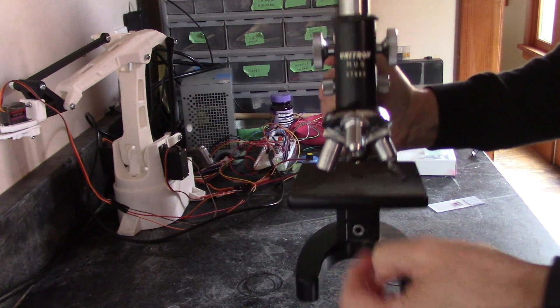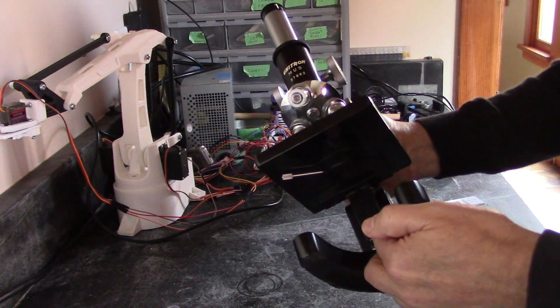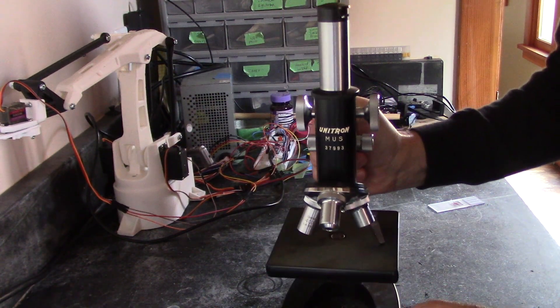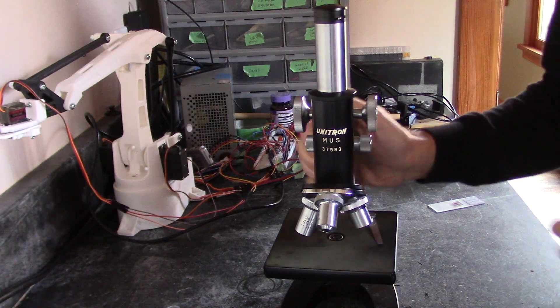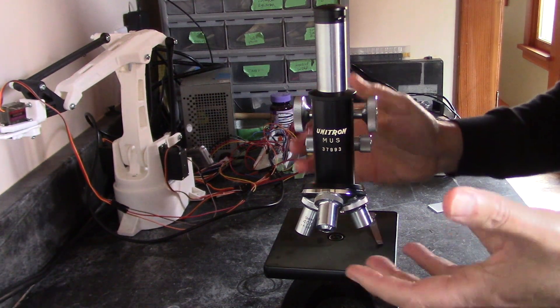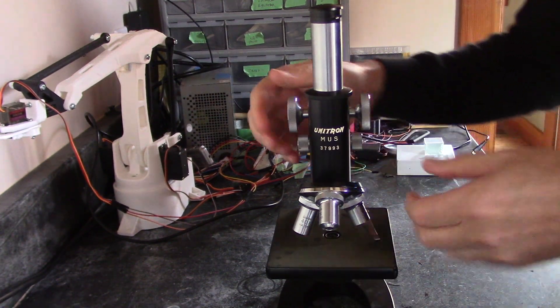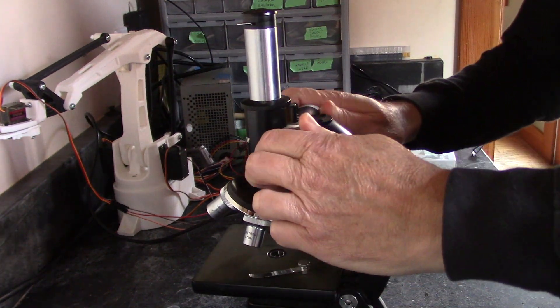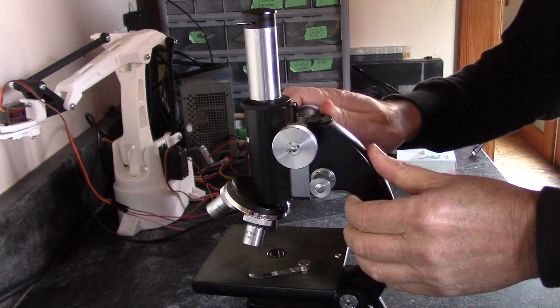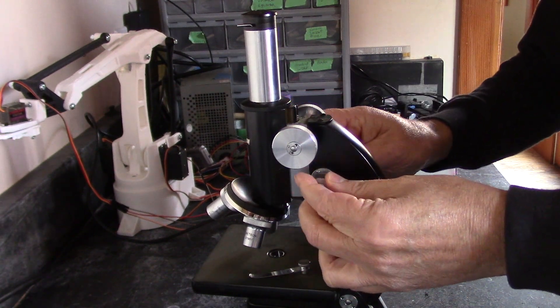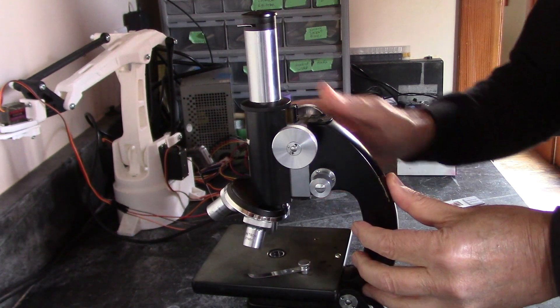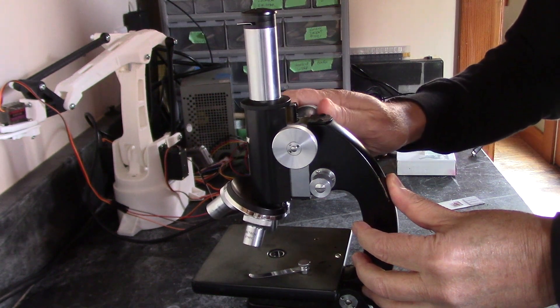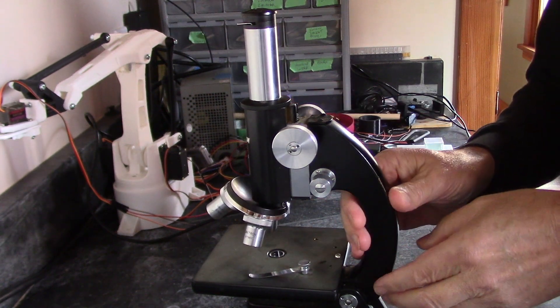But with those two minor problems, it really performs a lot better than I expected. It's really a student grade microscope, not a professional lab grade. But it's got a nice fine tune here and a coarse focus here.